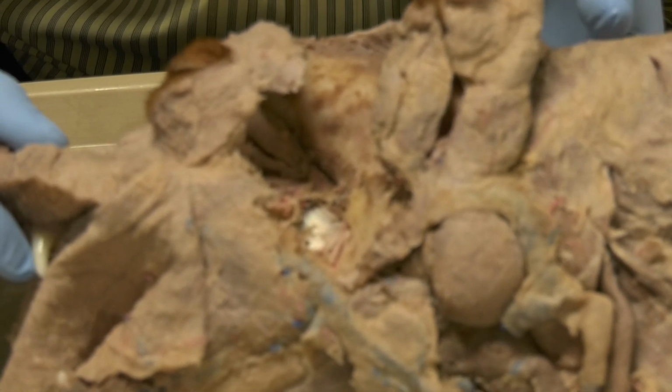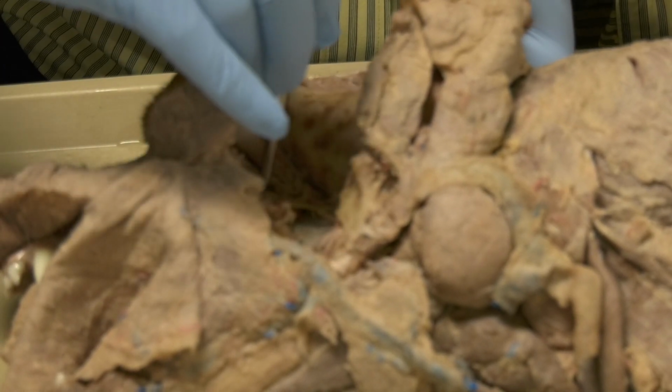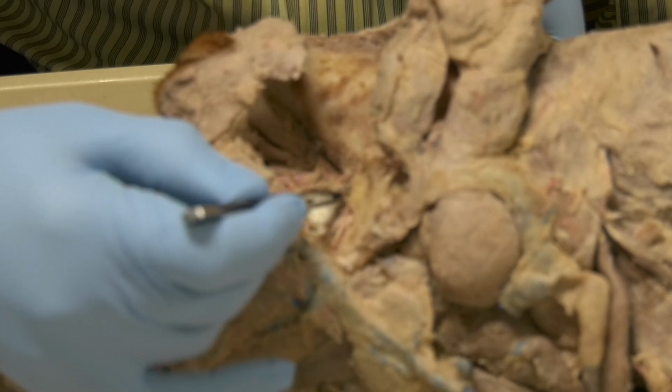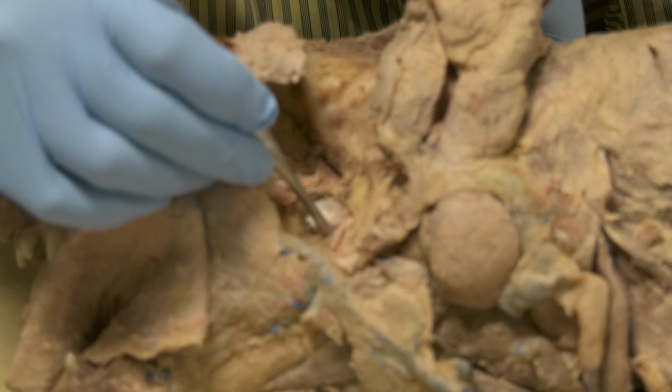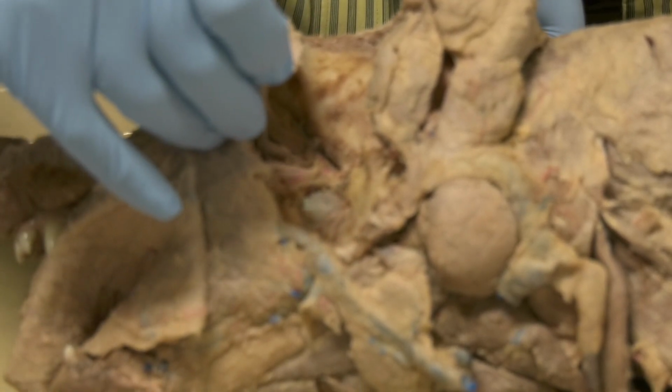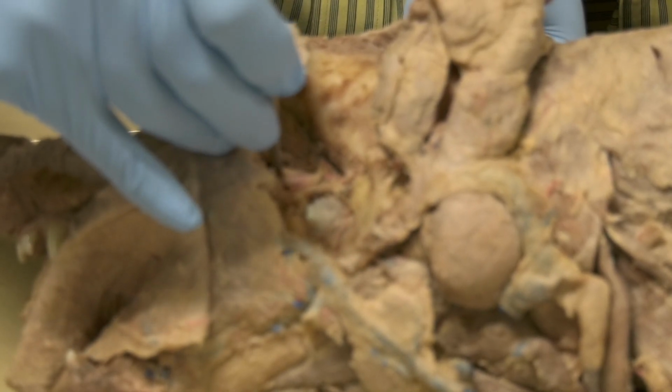Now, to see the branches of the mandibular nerve and to see the maxillary nerve and arteries before they go through the maxillary foramen there, okay, you need to remove the mandible. This will reveal this shiny structure here. This is the pterygoid muscle. And the nerves that you see here, 1, 2, 3, these are the branches of the mandibular nerve. Over here, you see the maxillary artery and the maxillary nerve.